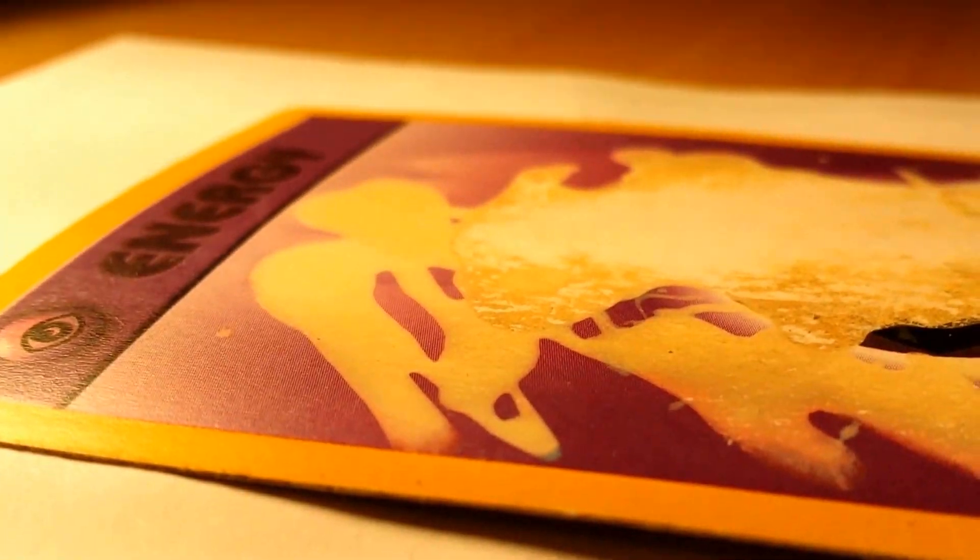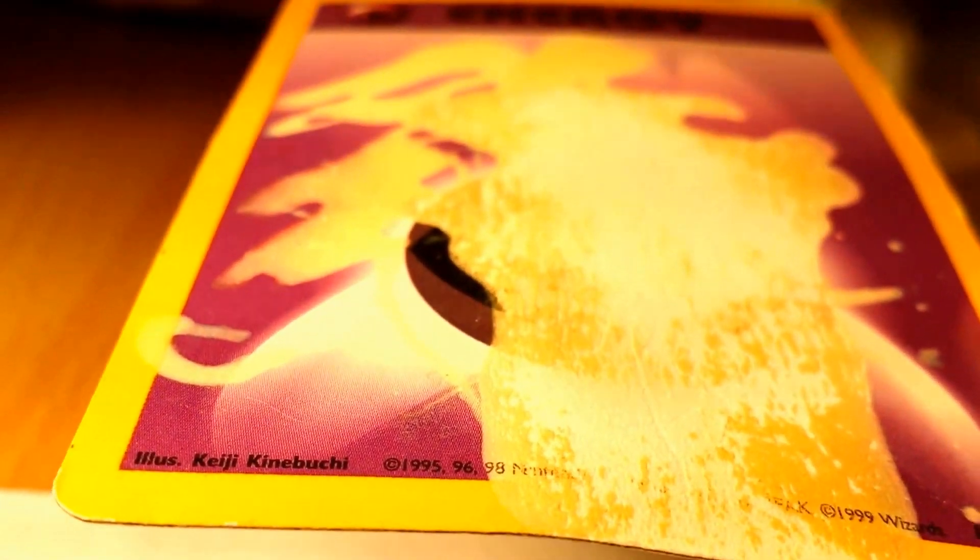Alright. Oh yeah. Oh, I washed it off. Anyway, let's give this a look. Wow, you can see the sulfuric acid ate away the dye. Oh yeah.